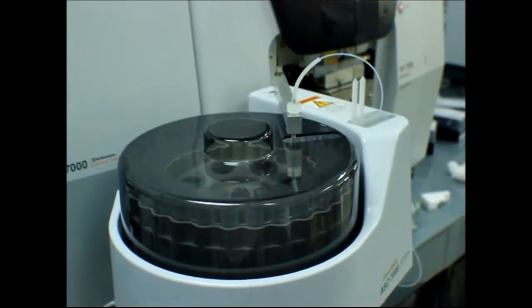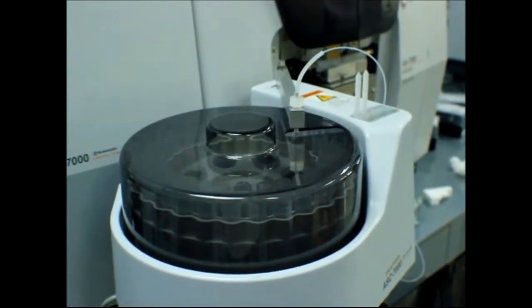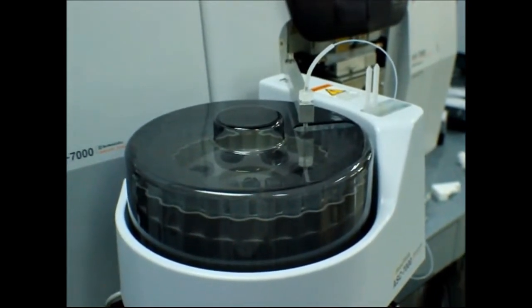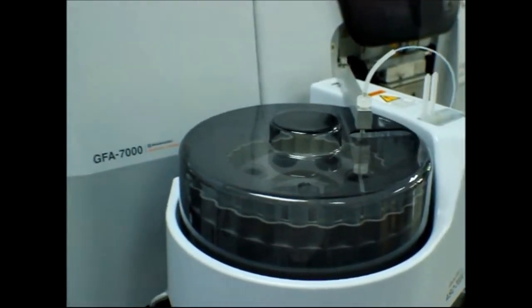You will run your blank. Log blank is not necessarily 0. It should give you some value. The value high or low depends on the quality. Okay, it's minus. Oh, minus, then should be okay. First, second, third. Then they will get your average.